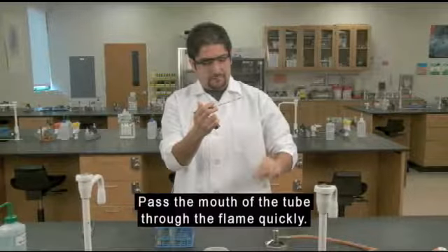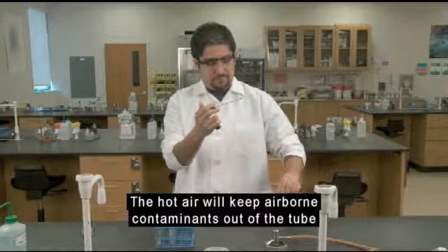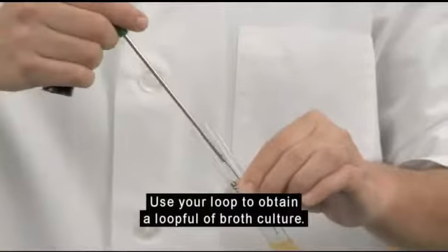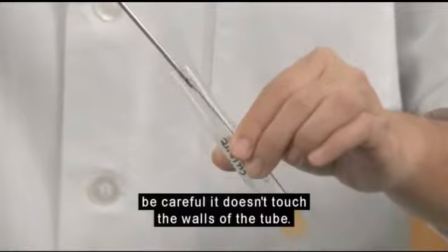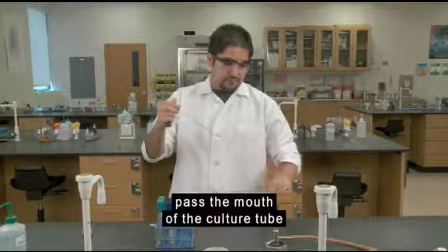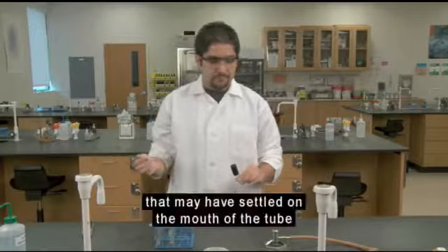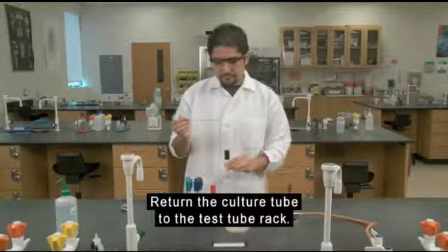Pass the mouth of the tube through the flame, quickly. The hot air will keep airborne contaminants out of the tube and kill any bacteria at the mouth of the tube. Use your loop to obtain a loopful of broth culture. As you remove the loop, be careful it doesn't touch the walls of the tube. While holding the loop steady, pass the mouth of the culture tube through the flame again and recap. This second flaming kills any bacteria that may have settled on the mouth of the tube while it was open. Return the culture tube to the test tube rack.